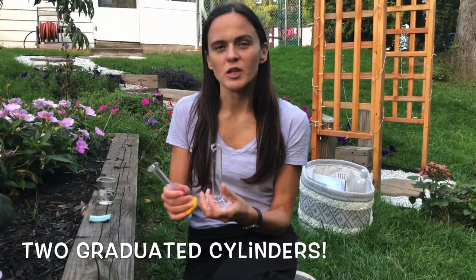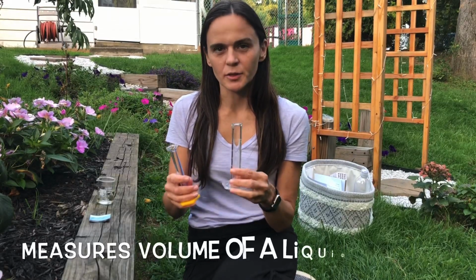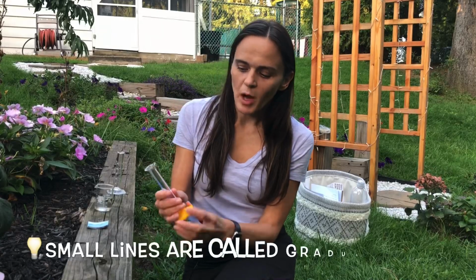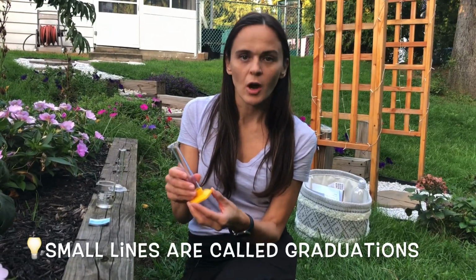Here we have two graduated cylinders. A graduated cylinder is used to measure volume of a liquid in the lab. A graduated cylinder has small increments between the whole numbers called graduations.